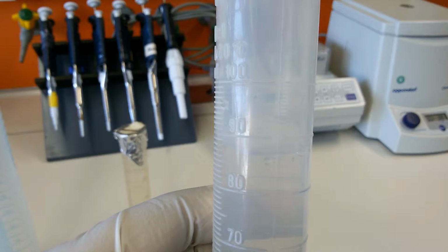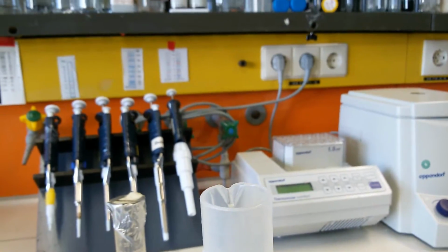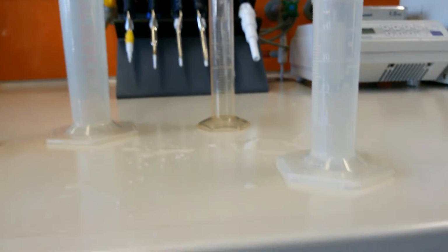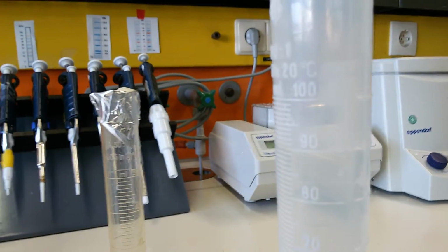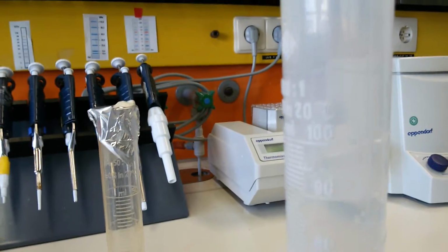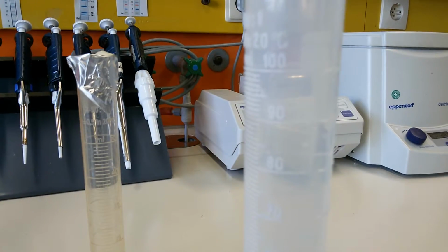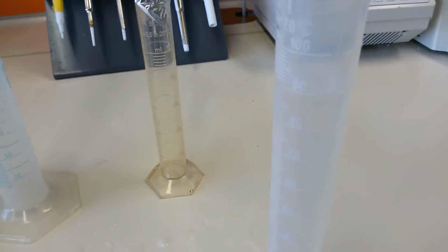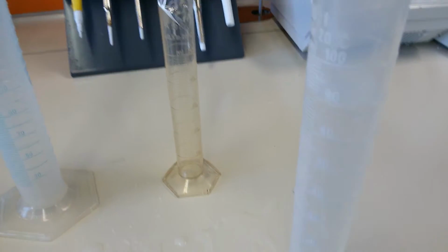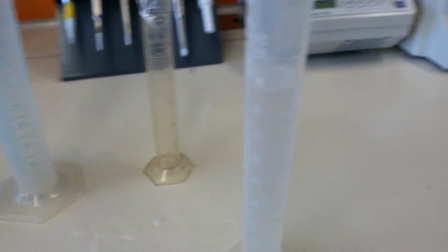This is 80, here is 90, but we only get the right reading when we put it on a plane surface. So now we put it on our bench, and then we can see. This is 90 here, and it is filled till here. If you shake it a little bit, you can see it. That's how you measure, and then you add it wherever you want to add. We will tell you about this in our buffer exercise, where we use the measuring cylinder. Okay, cool.